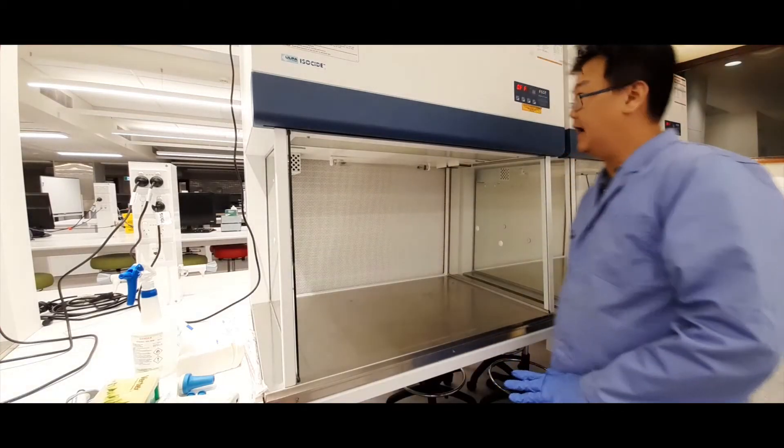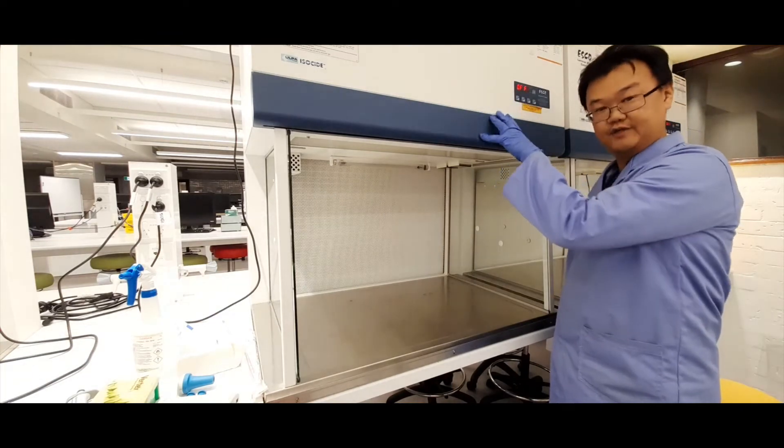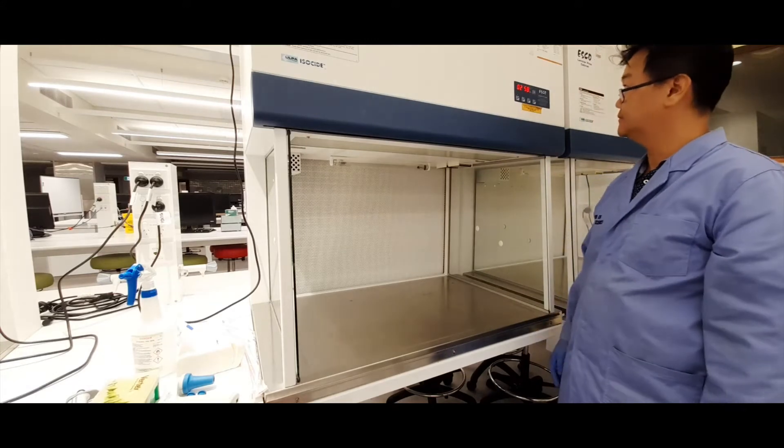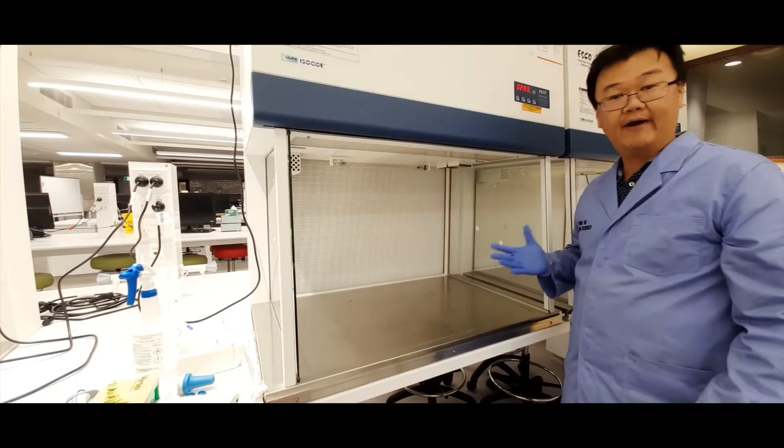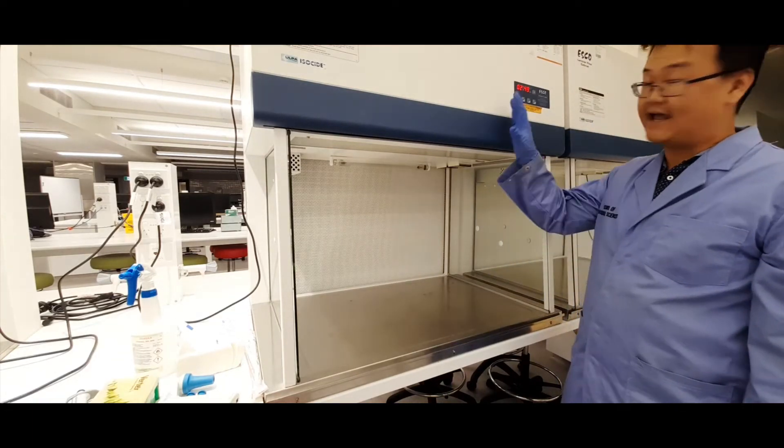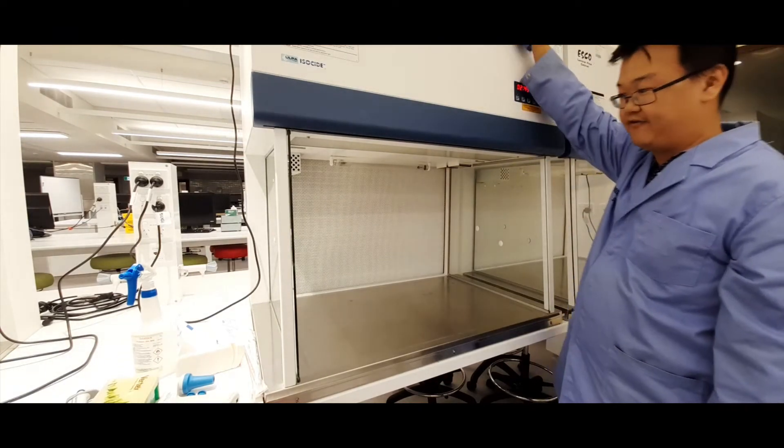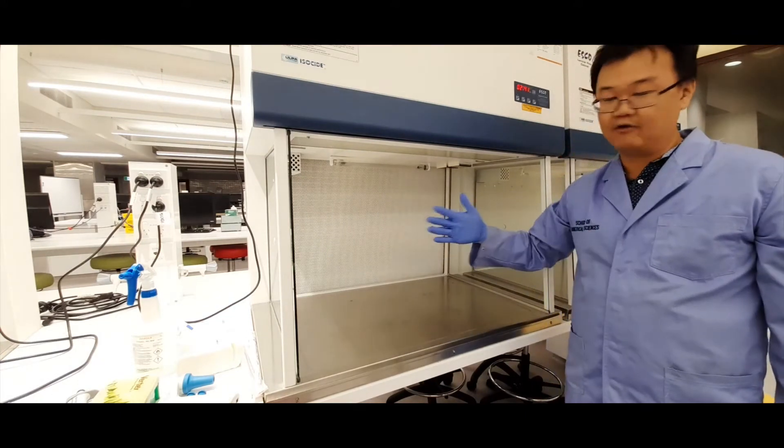And then there's also a button at the top here to turn the hood on, which turns the fan on. So I'll do that now, and you can hear the cabinet powering up. Hopefully you can hear me over the noise of this fan. What that fan does is it sucks air through the top through a HEPA filter and blows air from the back of the hood out towards you.